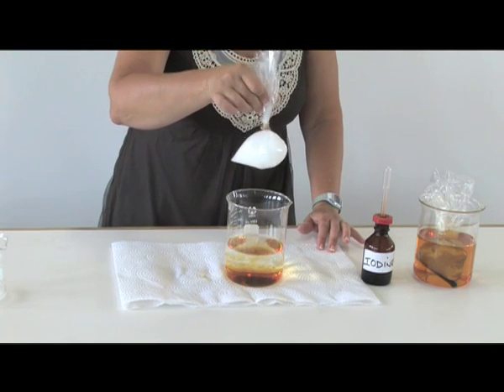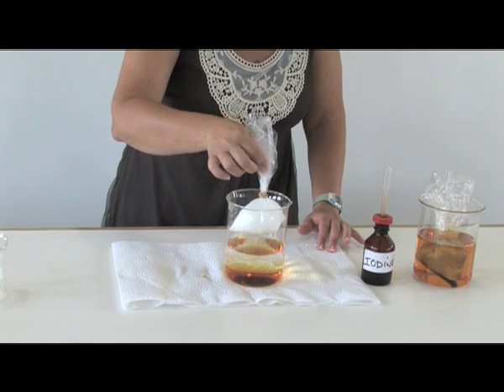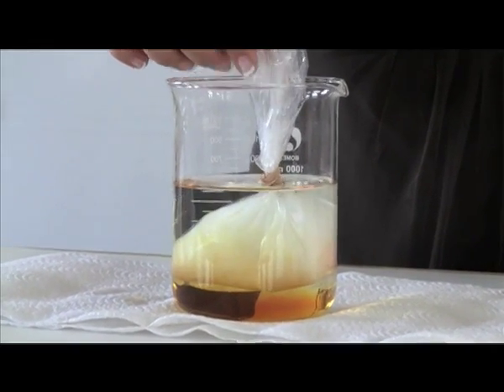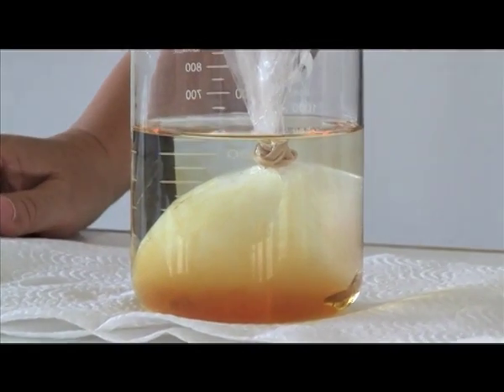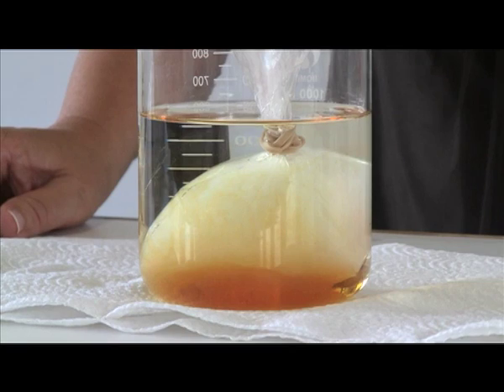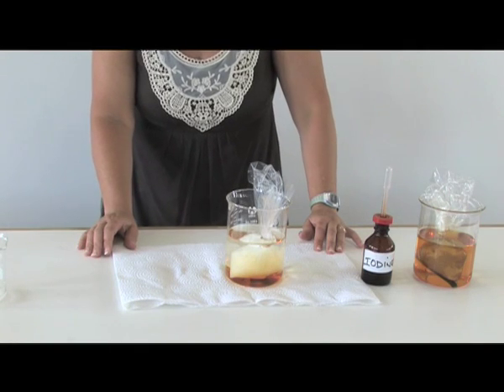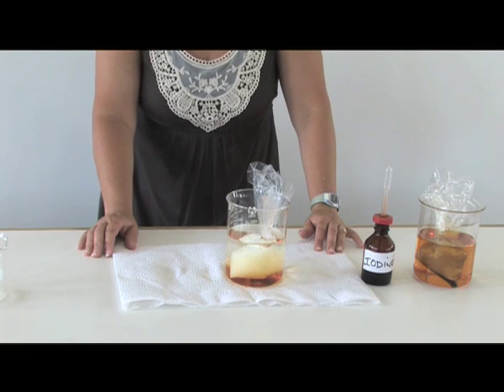What I am going to do is insert this plastic bag, which is filled with starch solution, into the beaker that contains dilute iodine solution. We want to show that the iodine molecules will move from a region of higher concentration into the plastic bag.